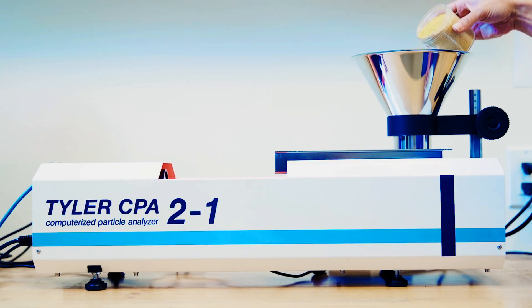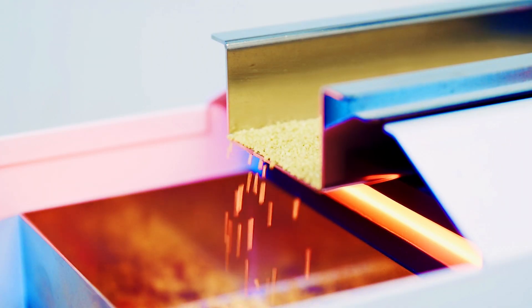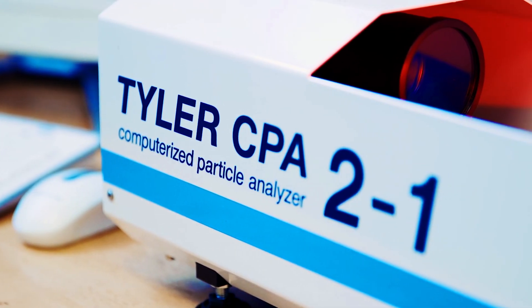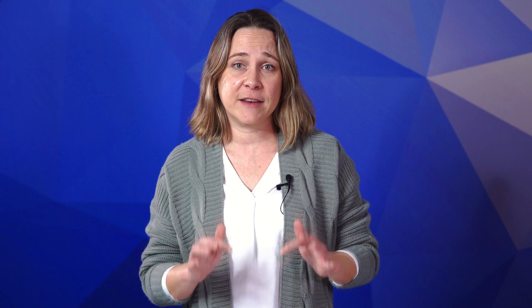Dynamic image analysis is when dynamic image analysis systems like the WS Tyler computerized particle analyzer, or CPA, are used to determine the size and shape of dry non-agglomerating particles as fine as 20 microns, like sand. The CPA utilizes a vibrating tray to drop particles past a high-resolution digital line scan camera that scans up to 10,000 lines per second.